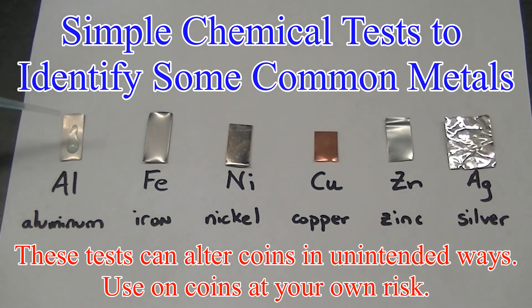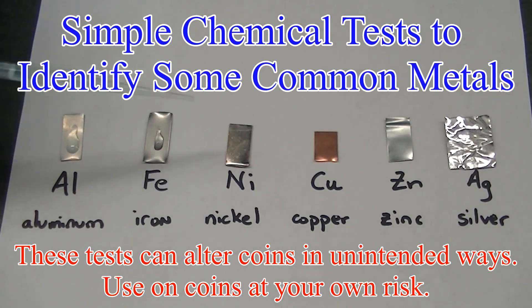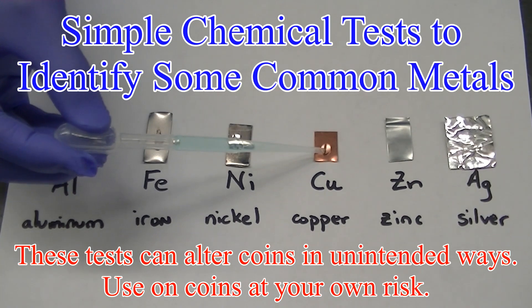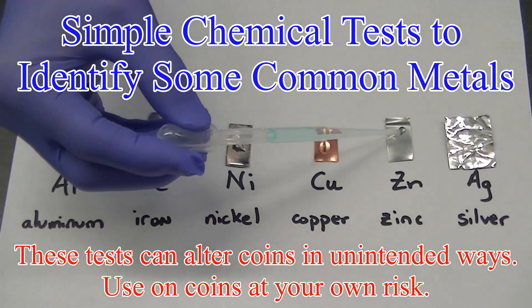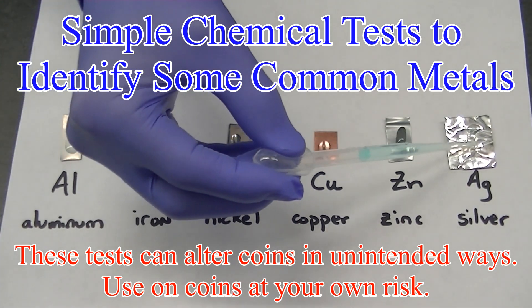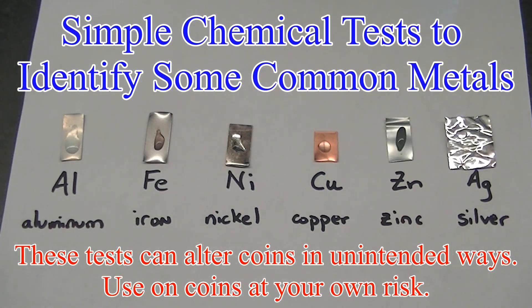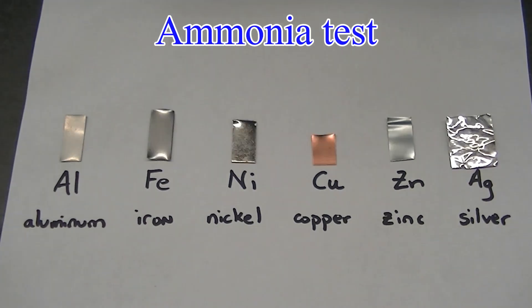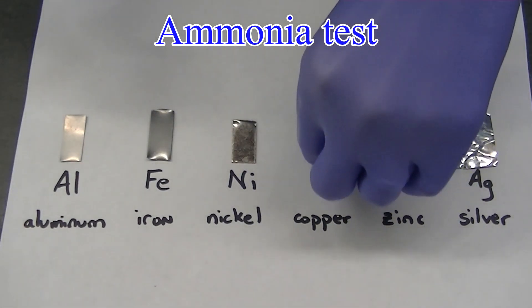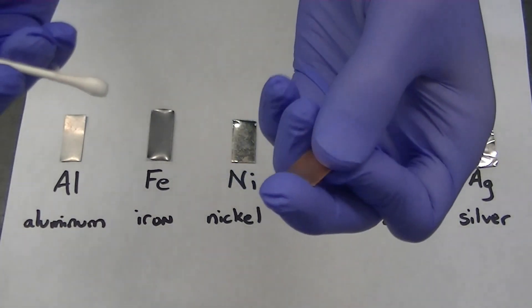Let's do some simple tests to identify some common metals found in coins: aluminum, iron, nickel, copper, zinc, and silver. First we'll do the ammonia test, which is a test for copper.